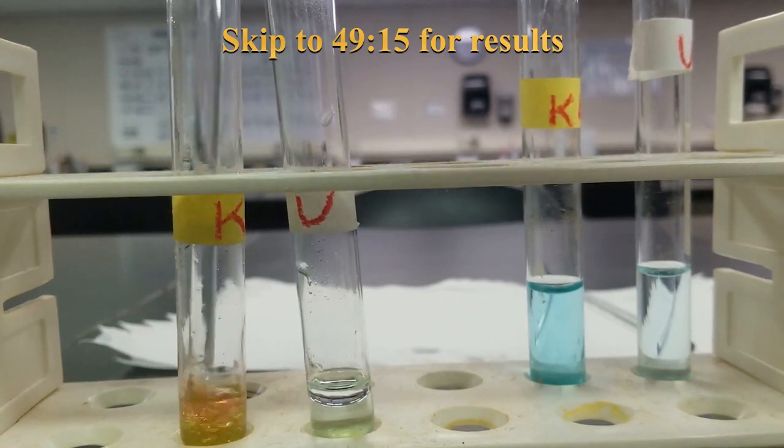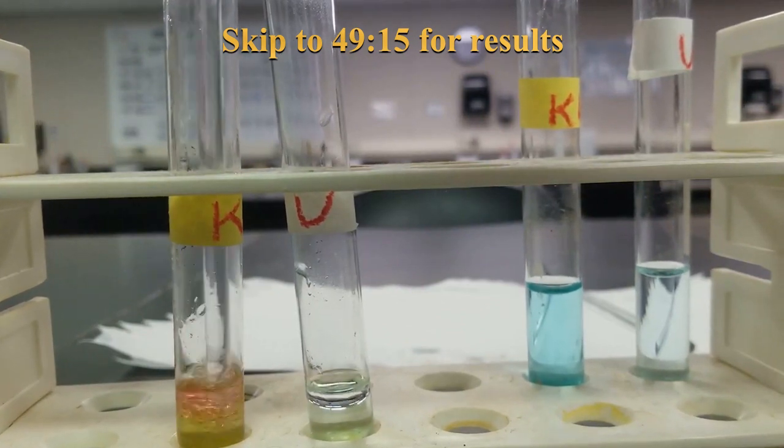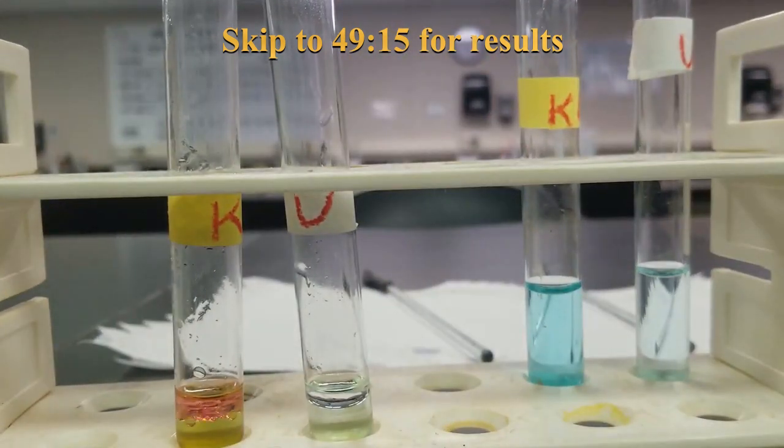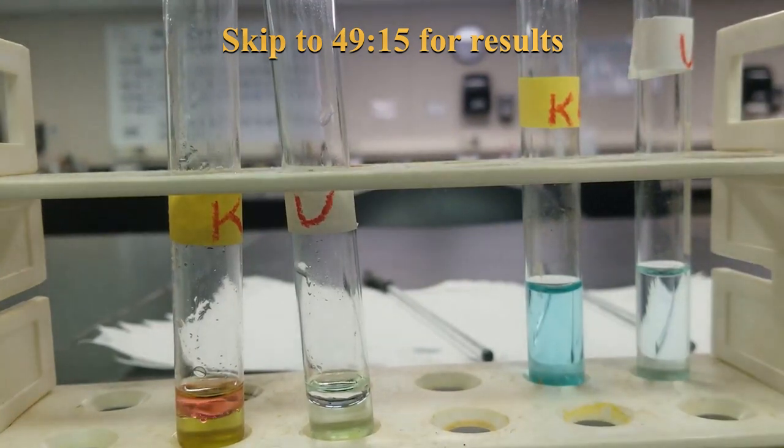Yeah, you can see you're still not done. Pipette out.